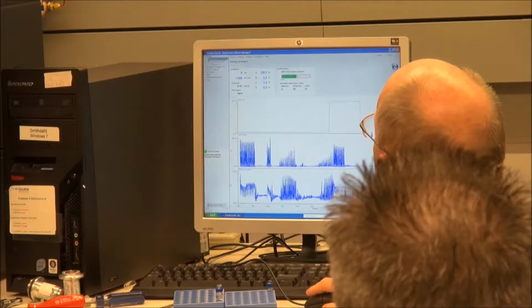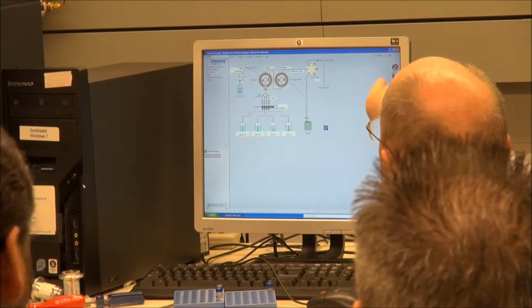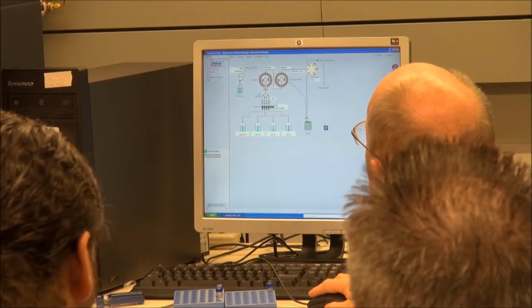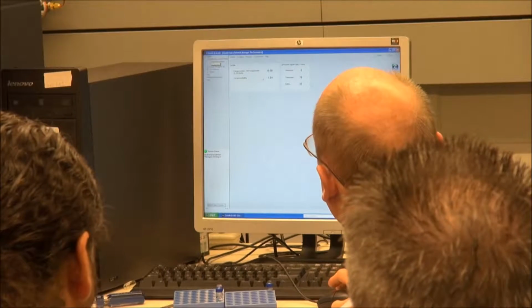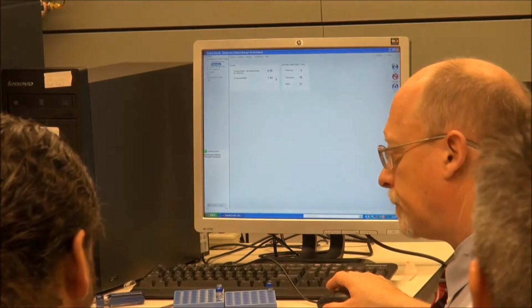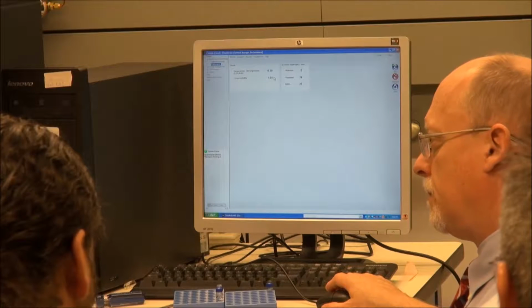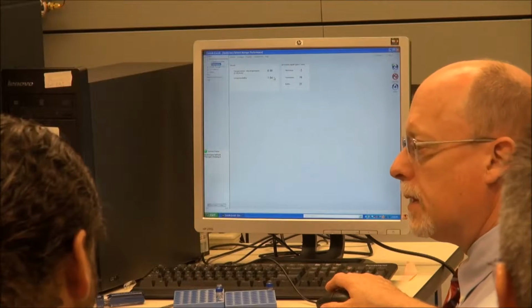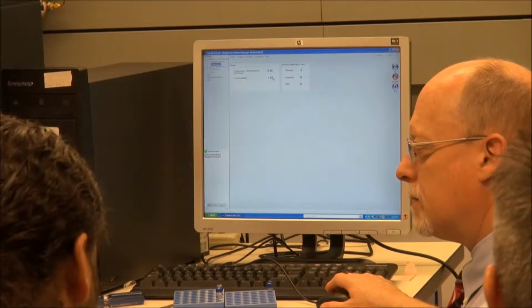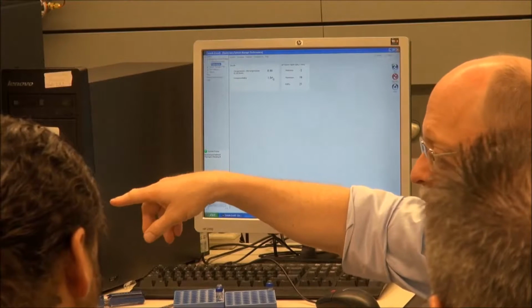You can go here to this plus sign and go to interactive display. You can see your flow path graphic and your pressures. And you can see performance, where you can have solvent compressibility. Compressibility is something that is estimated here because you've got all these pressure transducers.